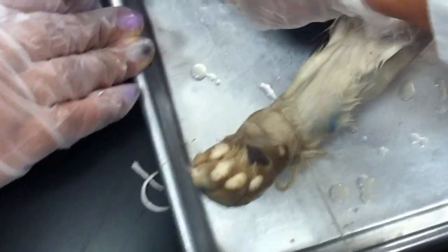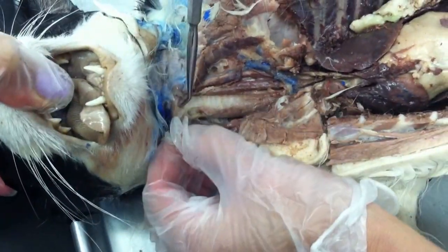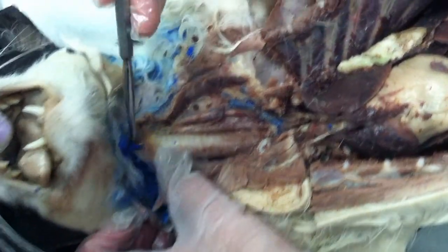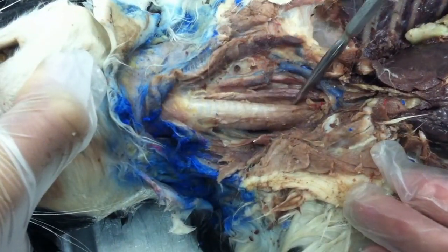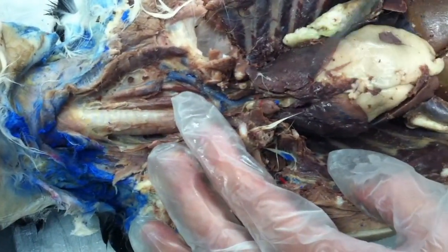All right. Now the trachea. Larynx, you still need to be able to identify. But you told us now. I'm not going to ask you which system it belongs to, but you need to be able to identify it. You see it here. That's the enlarged part, right? And this is the trachea. That's the esophagus. The lungs. It's very easy, right?